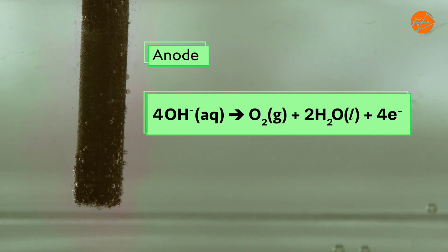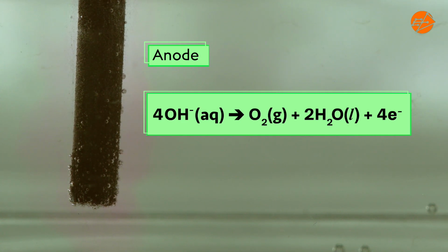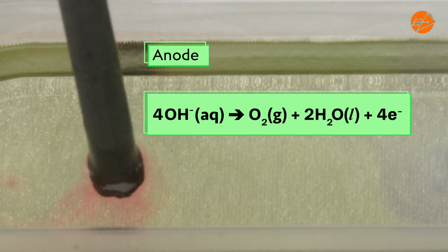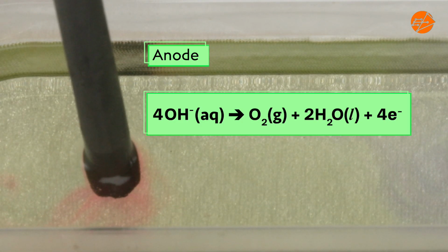During the discharge of hydroxide ions at the anode, the concentration of hydroxide ions becomes lower than the concentration of the hydrogen ions. This lowers the pH, causing the universal indicator to turn from green to pink.